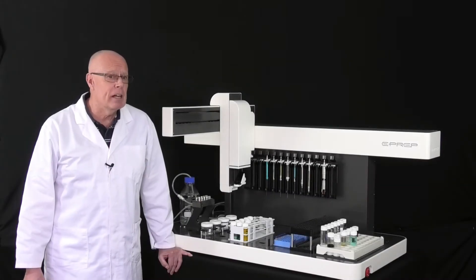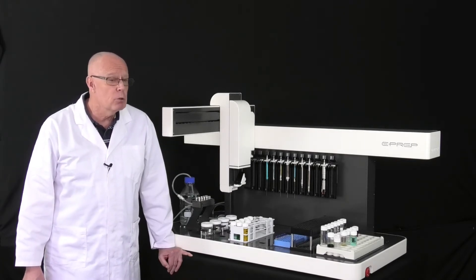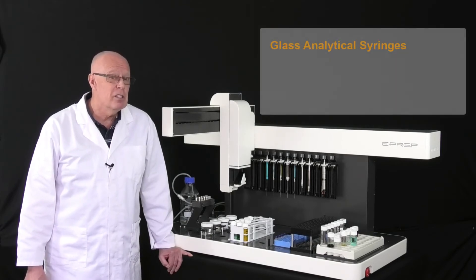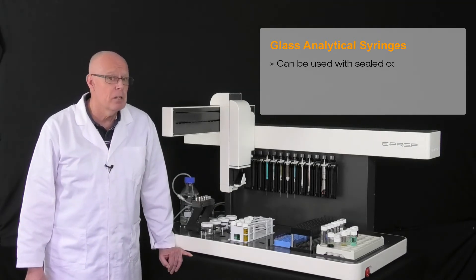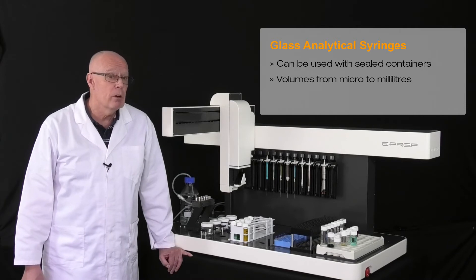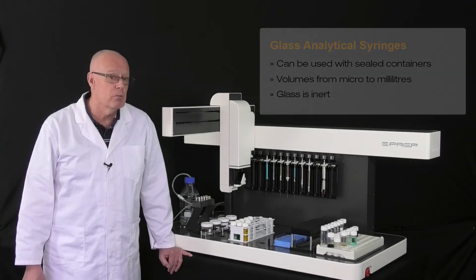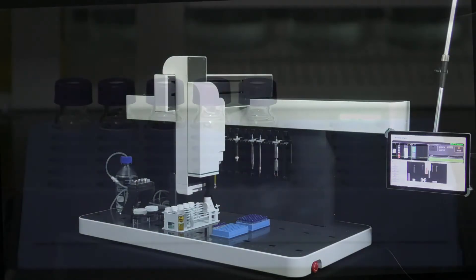At the heart of the E-PREP is a glass analytical syringe. The syringe gives us many advantages but is difficult to use manually — an inexperienced user can bend the needle, bend the plunger, and make a mistake when reading the volume. One of the benefits of a needle is that it can pierce the septum of a sealed container, so sample integrity can be maintained and chemical exposure eliminated. Syringes create flexibility because volumes dispensed range from the sub-microliter to milliliters, and glass is more inert than plastic. So how can we realise the benefits of the syringe? Stick it in a robot and get the robot to control it — this is essentially what the E-PREP is about.